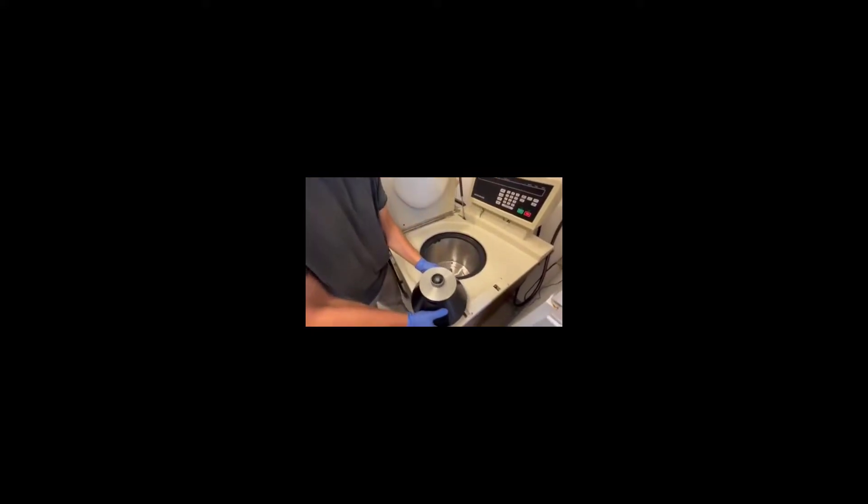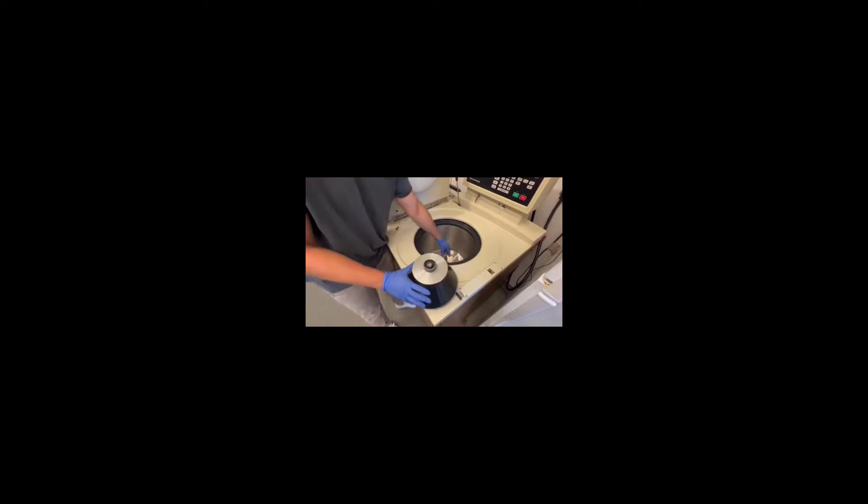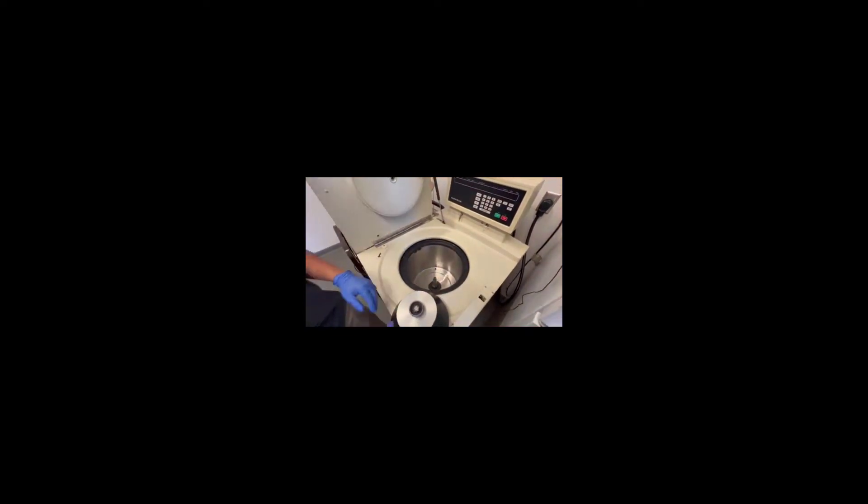On the inside, this is going to be the rotor which holds your centrifuge tubes. On the bottom, it's connected to the motor which will work at a certain speed and temperature and time while you're doing the centrifugation.